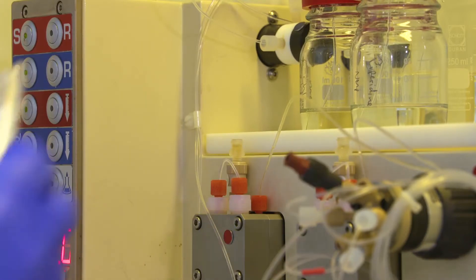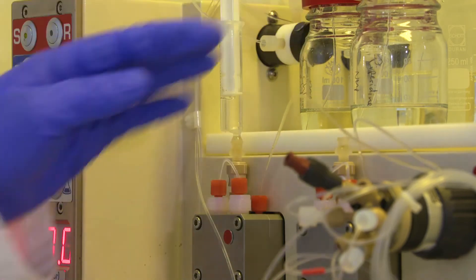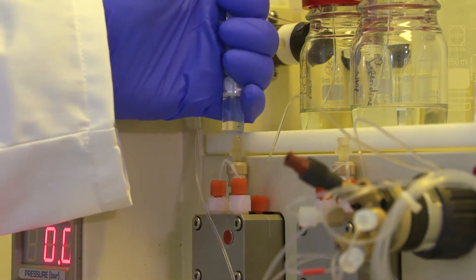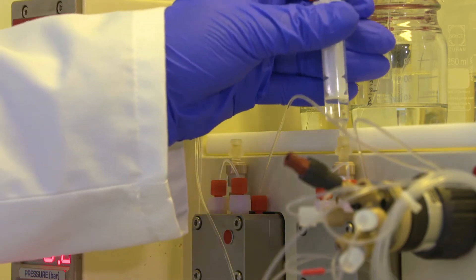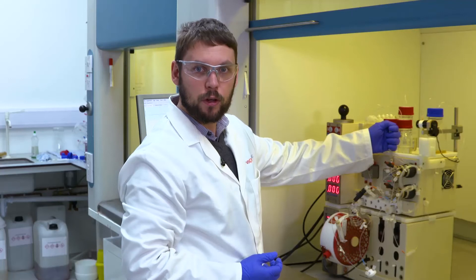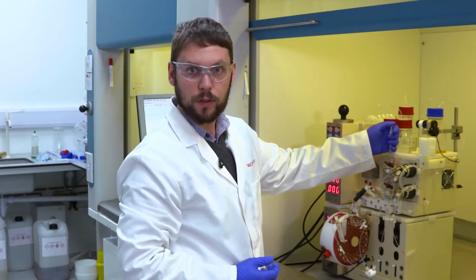To do that I use some clean solvent which I inject into these inlet ports on the top of the pump. I do it for both pumps and it's good practice to use the solvent that the reagent on that pump is dissolved in.